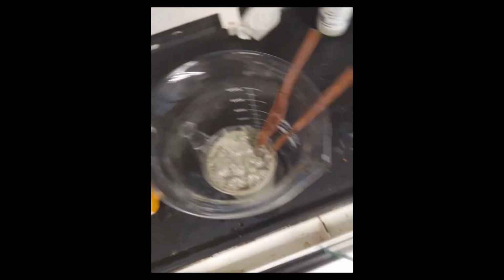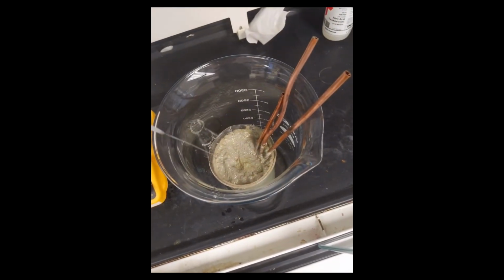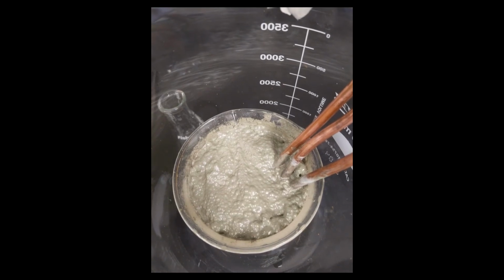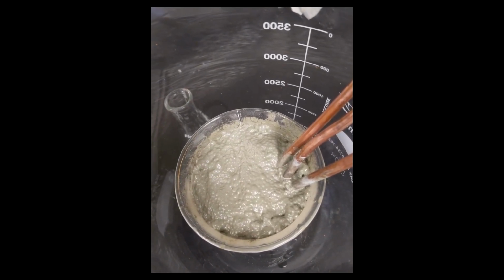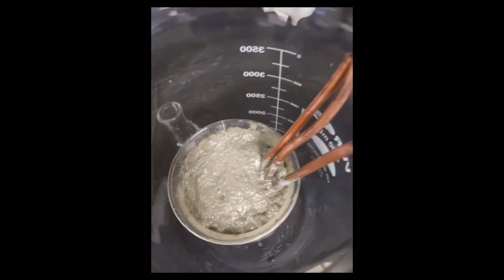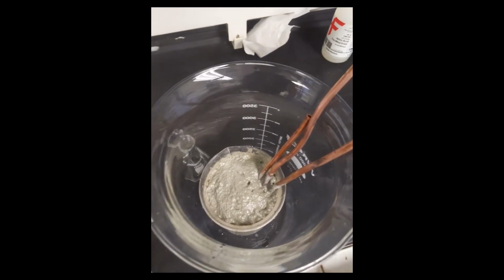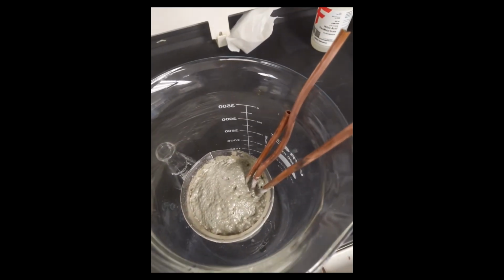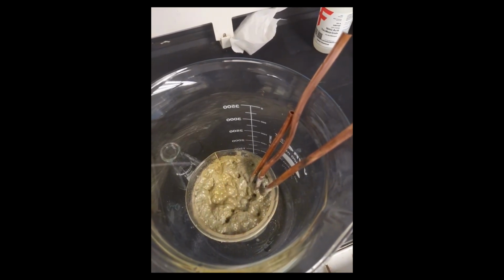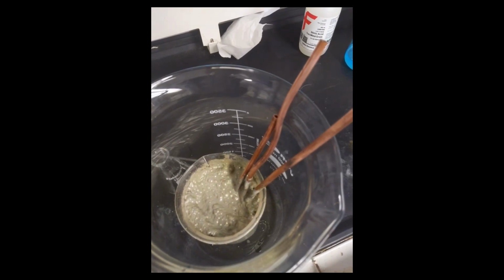Something I'm having to deal with is with this foaming and expansion. Look what happens. It's rising very slowly, but enough to make it overflow. That's why it's in this double-walled container now. So yeah, the residual acid is reacting with the copper to make various gases, mostly not so good nitrogen gases, and it's so thick that, look, see? I have to pop it, which adds water, which makes it a little bit closer to the top. So yeah, I'm a great chemist.